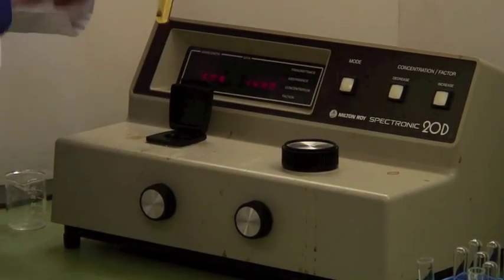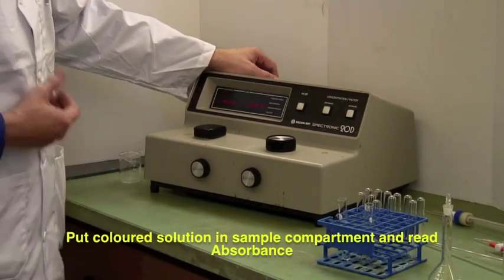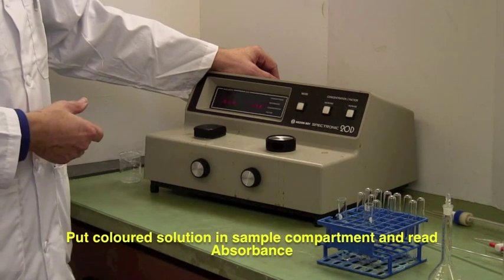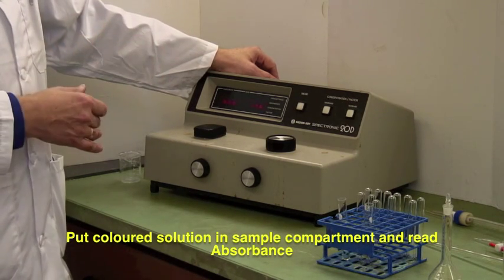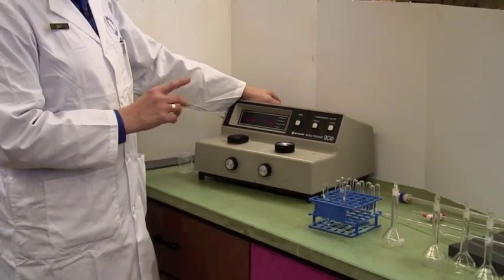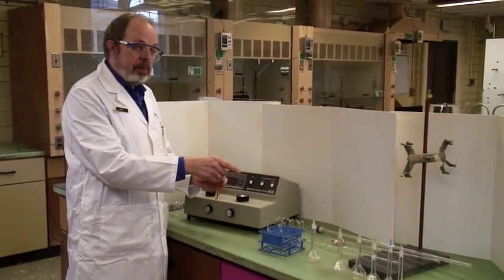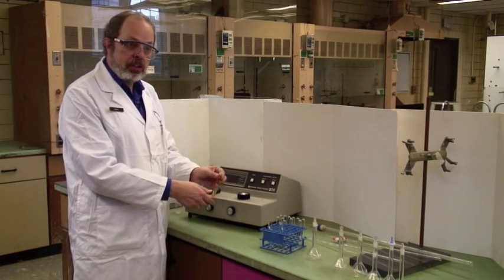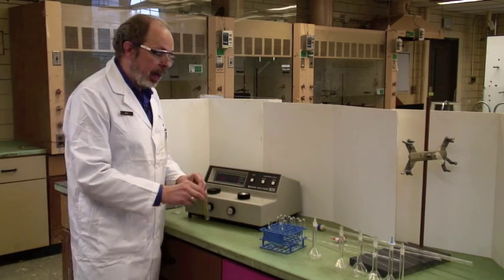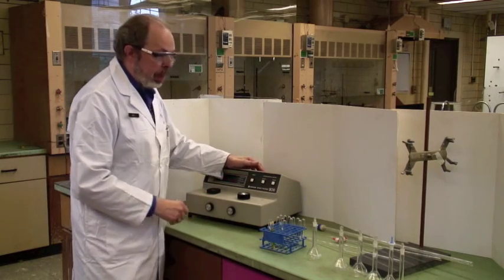You'll then have a cuvette of your colored solution. Pop it in, and that has an absorbance of 0.176 in this particular case. You will be reading about 20 different solutions. Once you've got them all ready to go, it'll be quite quick. So I would take this, dump it out, take my solution, rinse it with the next solution to be measured, dump that as well, fill it again with the second solution, pop it back in, and read. And that's all there is to the Spectronic 20.